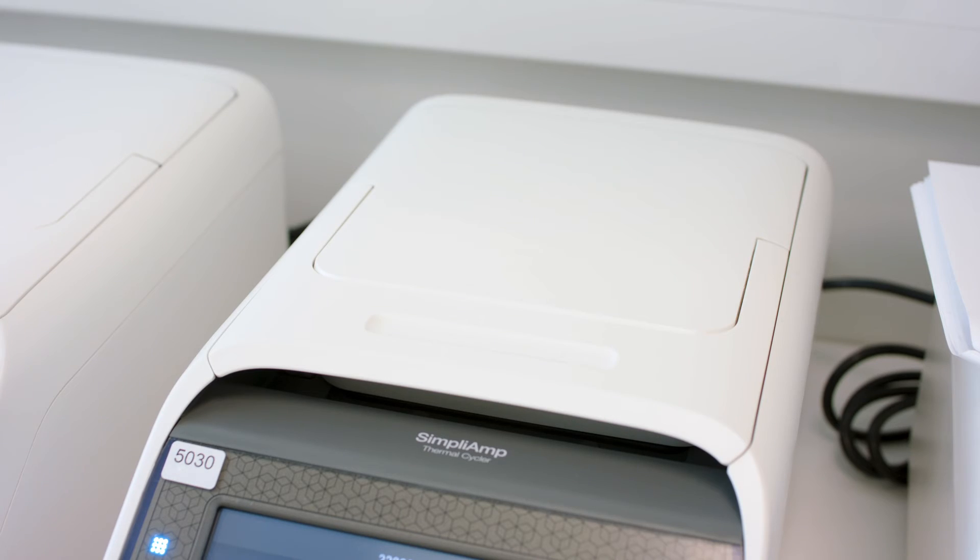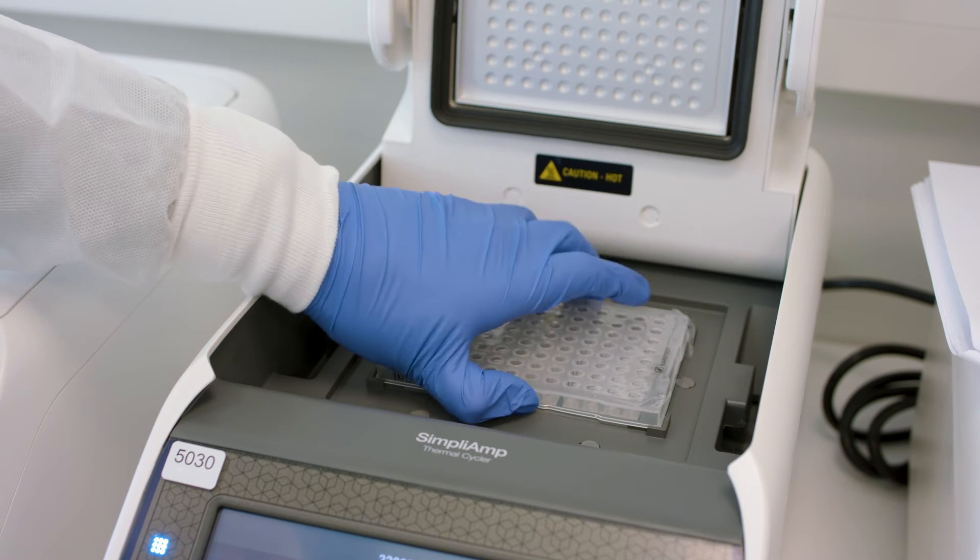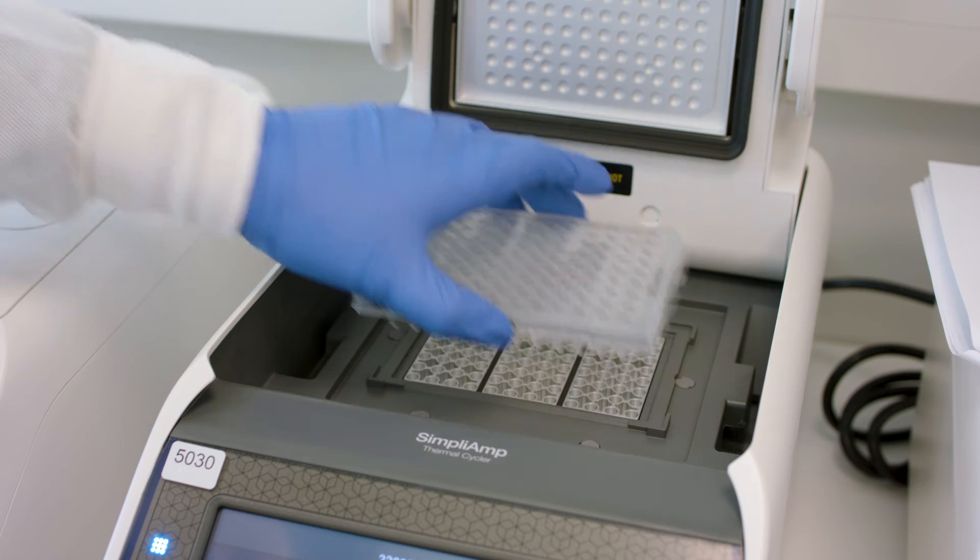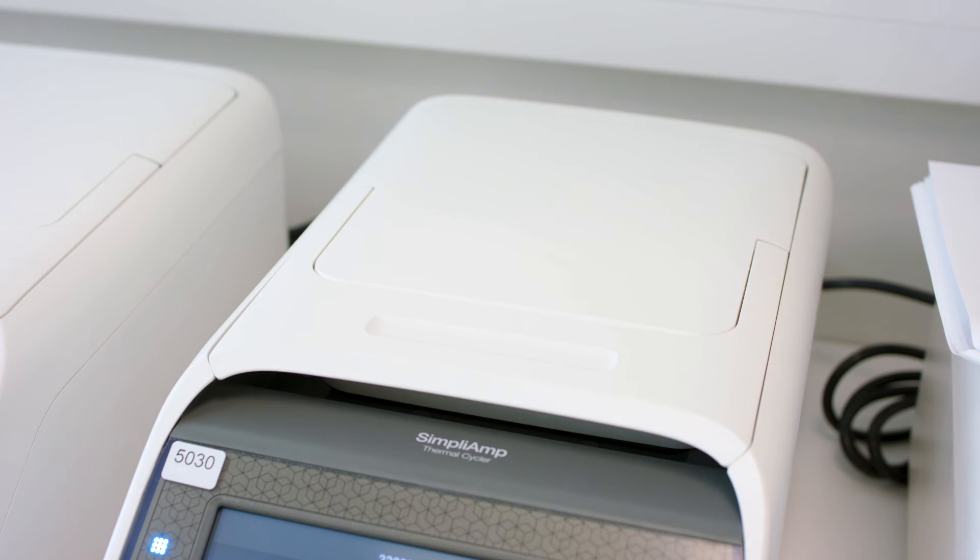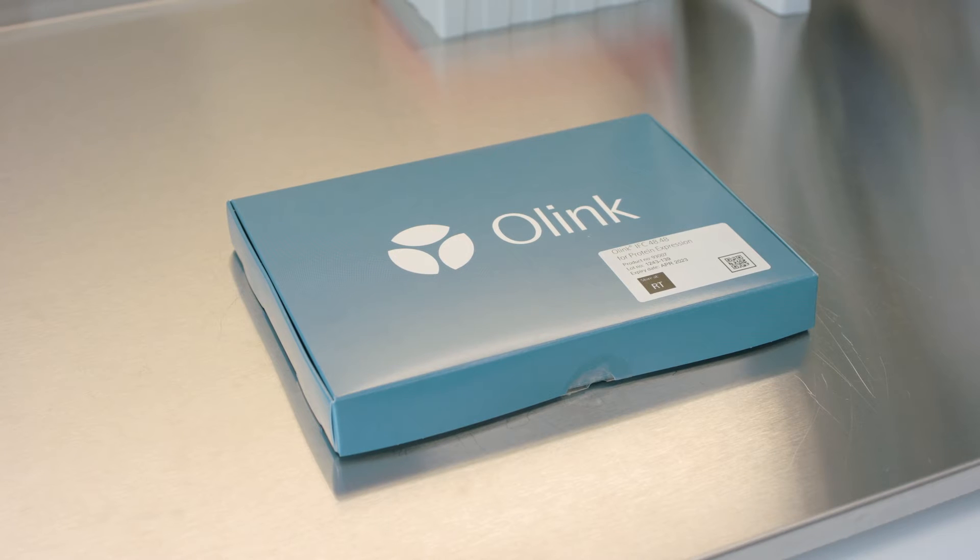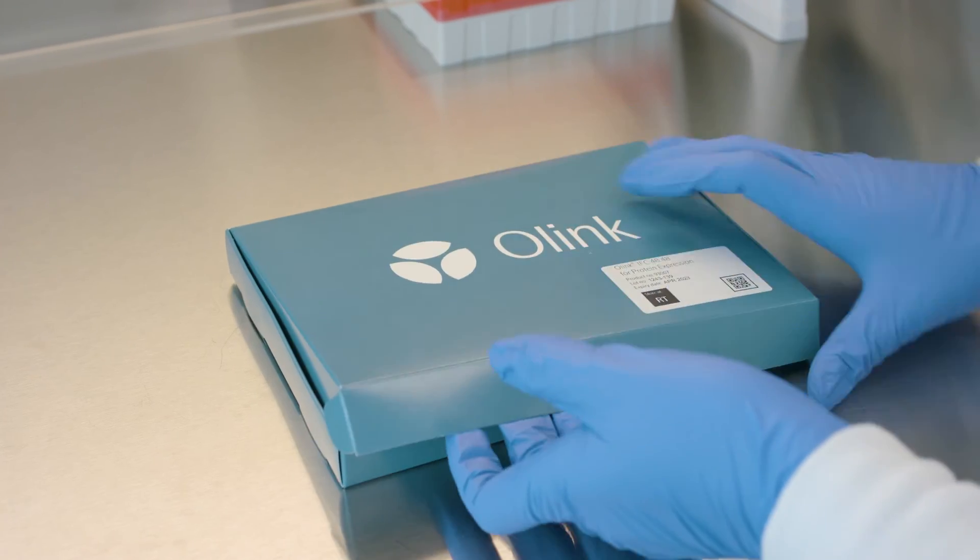Once the PCR program is finished, either continue with the detection step, or store the extension products for up to 1 week at 4 degrees Celsius, or up to 4 weeks at minus 20 degrees Celsius. The final step involves preparing samples for QPCR using the Olink Signature Q100. This begins with priming the Olink 4848 IFC.